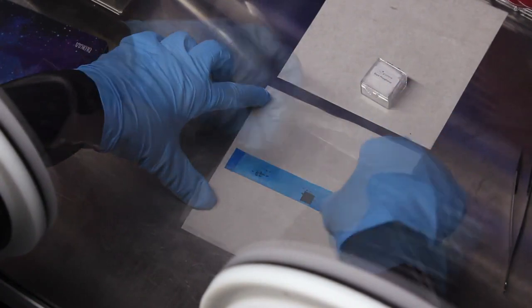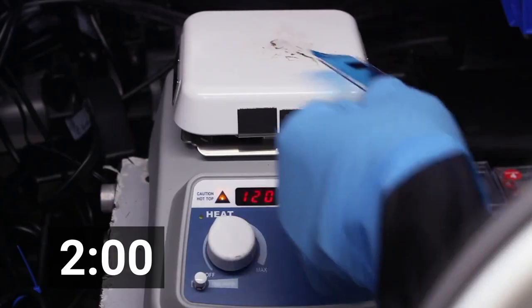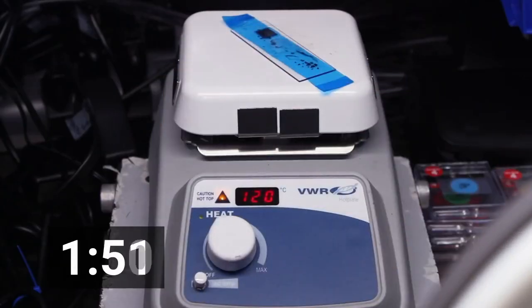Place the tape and substrate with substrate side down on a hot plate at 120 degrees Celsius for 2 minutes.